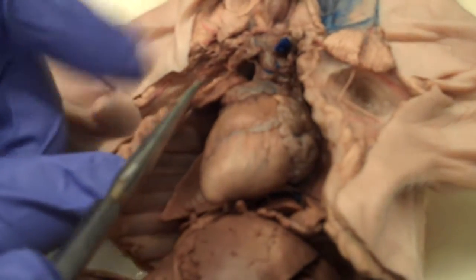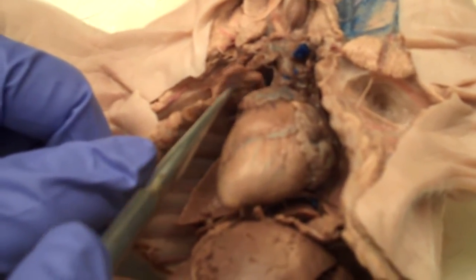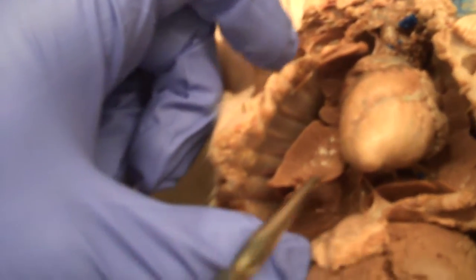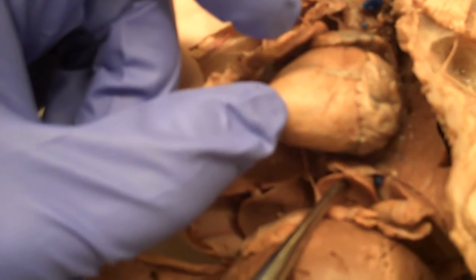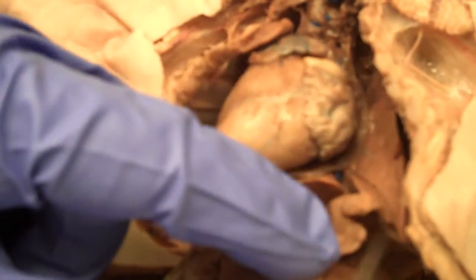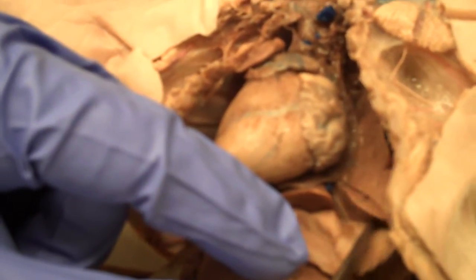There are four lobes of the right lung: the cranial lobe of the right lung, the middle lobe of the right lung, the caudal lobe of the right lung, and the accessory lobe of the right lung. There are two lobes of the left lung: the cranial lobe of the left lung and the caudal lobe of the left lung.